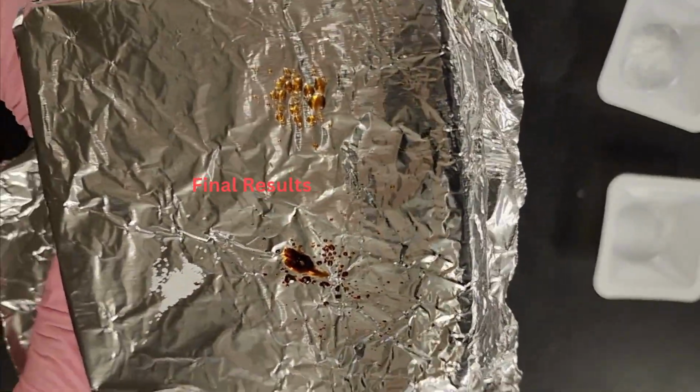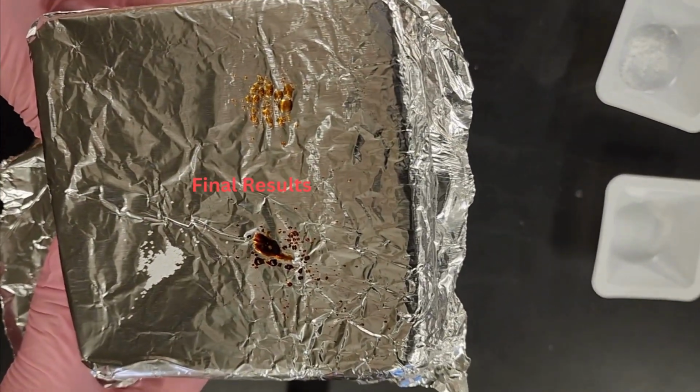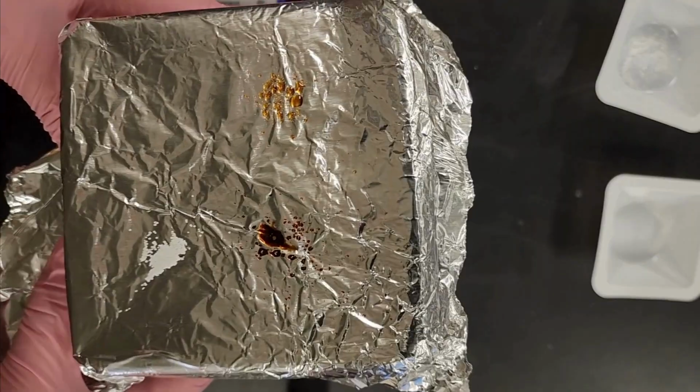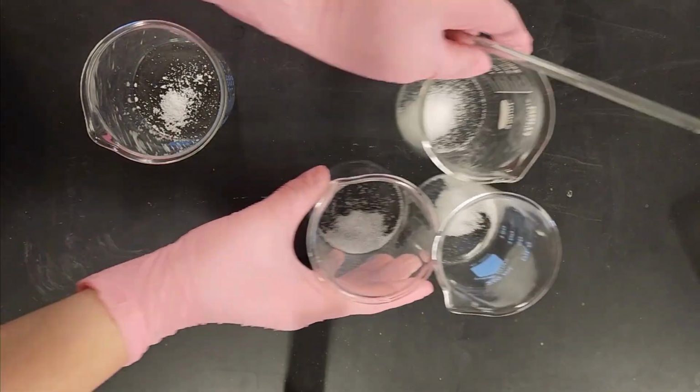You can see the naphthalene had fully melted and then evaporated. The dextrose and the sucrose both melted and then burned as the hot plate was continued to stay on, and the sodium chloride didn't show any signs of melting and stayed in its original form. In part 2 of this experiment, we will be looking at solubility of the same chemicals.